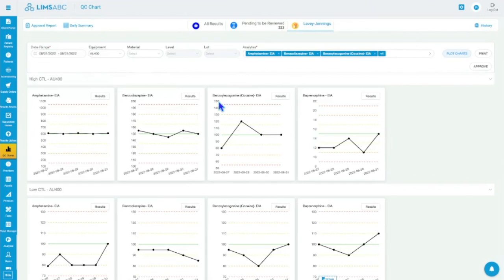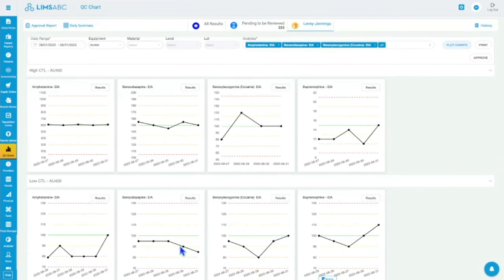We can do the trending rules, the 12x, when you have 12 results above your mean. Let's see, do I have a chart like this one here? This would probably, well, just 5, but let's say you have 6 of these results. That means you're trending below your mean, and then it might be something that you want to investigate. So we can turn that on as a warning. This one is good because it goes above and below your mean, but this one is trending below your mean. So 6x is the first one, 6 results below the mean or above the mean, and we can turn that on to be a warning.